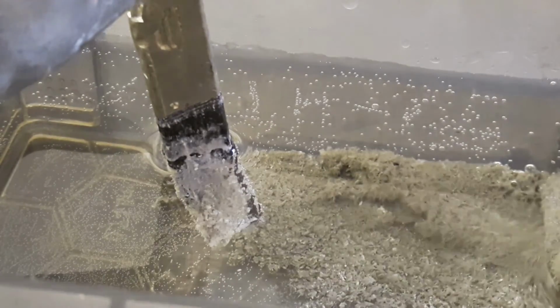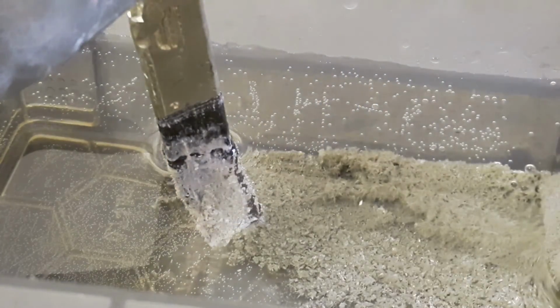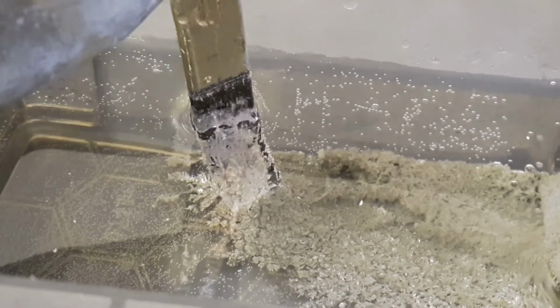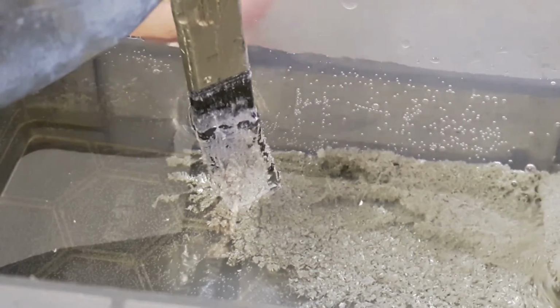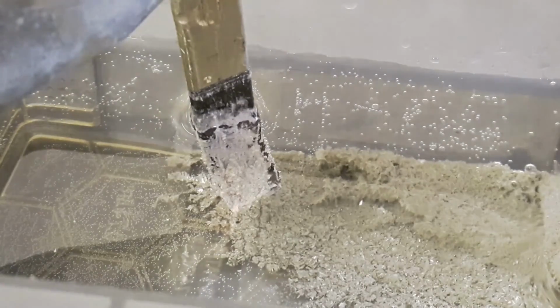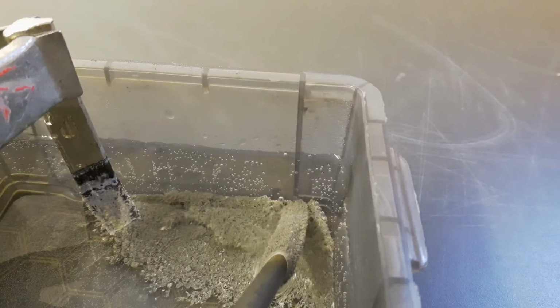Sorry for that. I was not able to record this on camera because its resolution, it's actually full HD, but the resolution is too bad. So maybe you can see these blurry lines right there. You see, there's always a bit of blur. I don't think you can see the ions' reaction to the magnet.